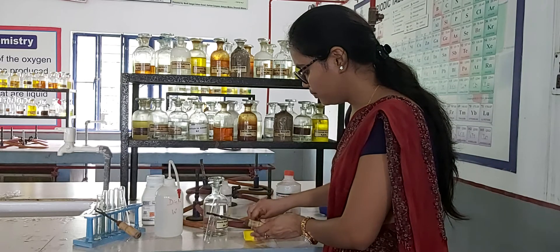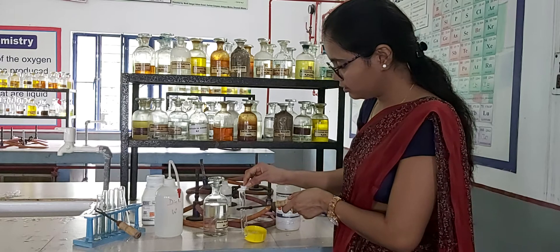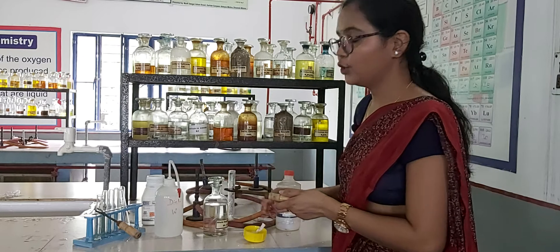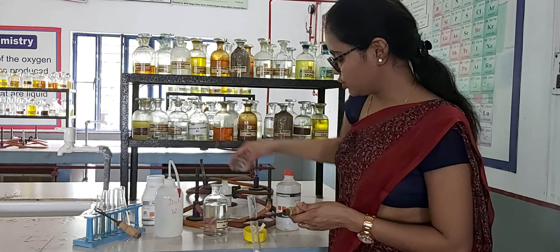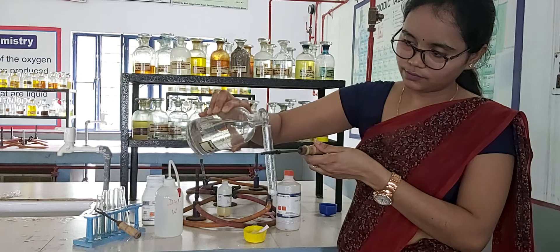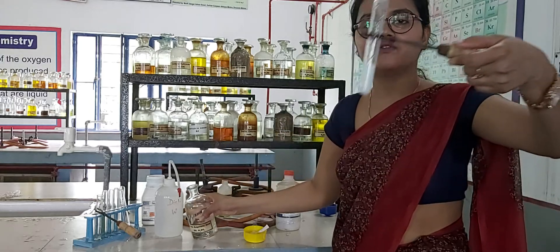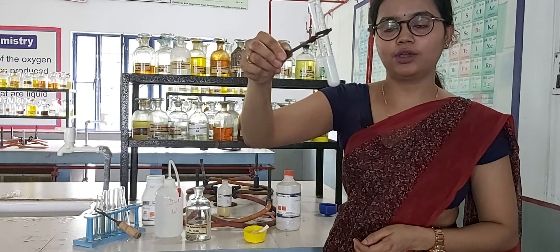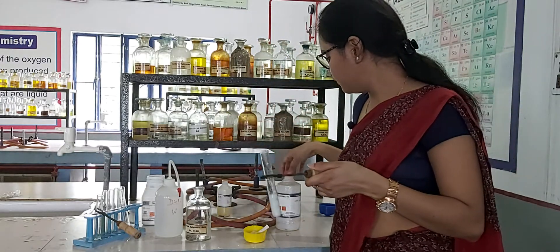For the detection of the first group, we will take a small quantity of the given salt, then add the group reagent of the first group, which is dilute HCl or dilute H2SO4. Here I am using dilute H2SO4. When you add dilute H2SO4, you will observe brisk effervescence, which indicates the carbonate ion, because the gas produced is CO2.